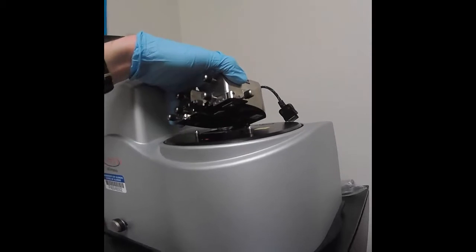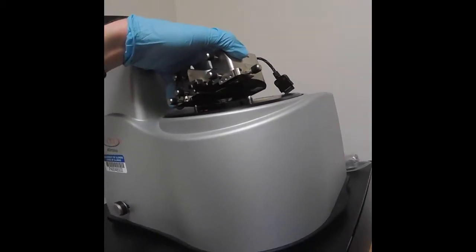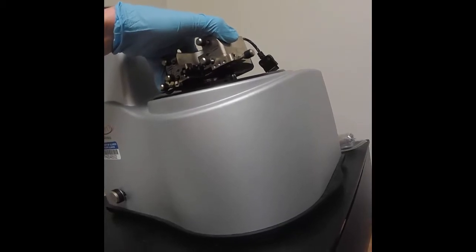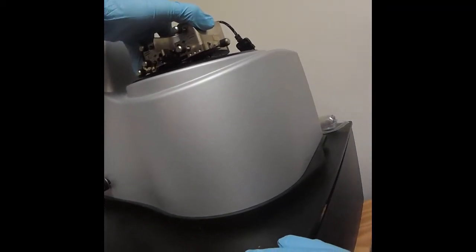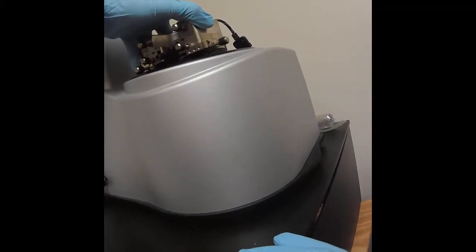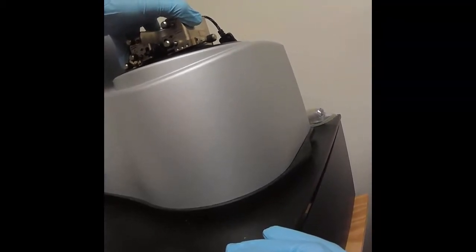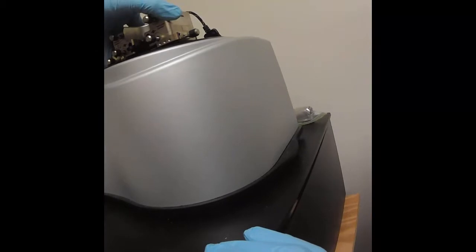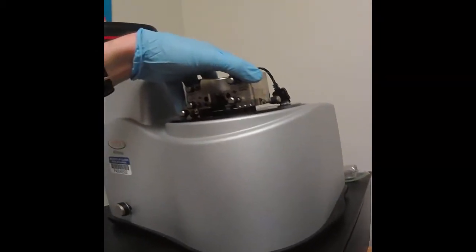So I start from the back, easy to hit that large target, and now I go to the left side slot there. And then on the right side, I have to wiggle a little bit until it locks in place like that, like so.